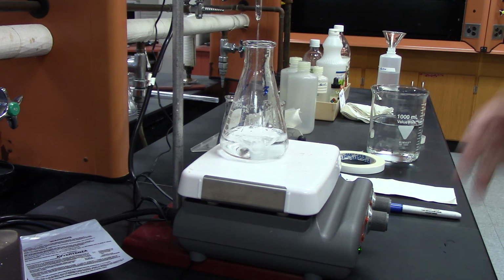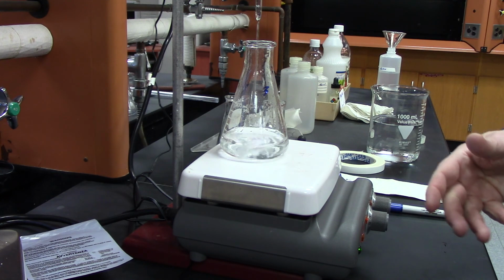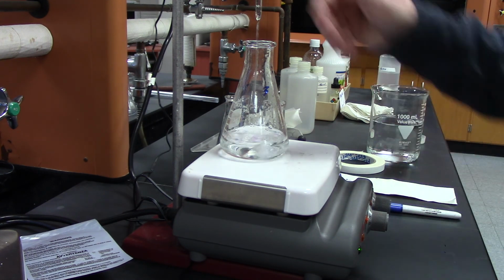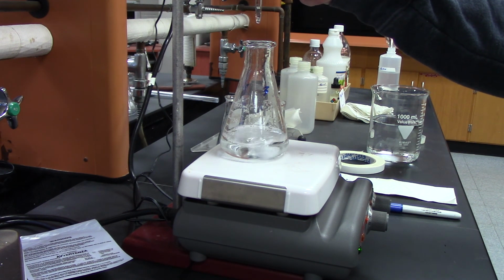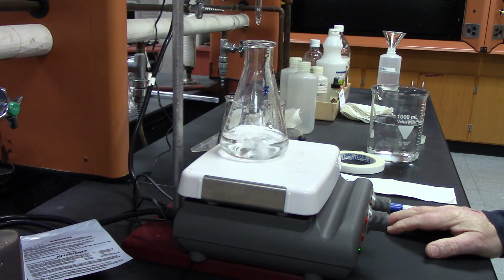After this video, I'm going to turn off this video and get prepared for the second part of it. So there'll be 2 videos with this lab. One is figuring out the concentration of sodium hydroxide, and the second one is going to be determining how much acetic acid you got. So right now it's at 29, so I'm going to get a nice little flow here.